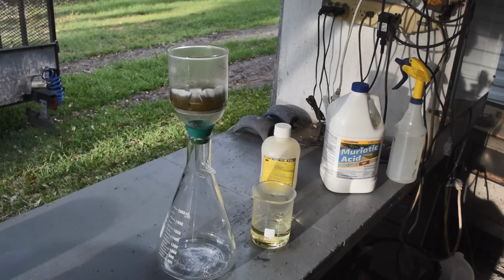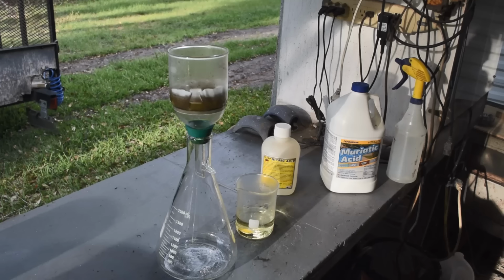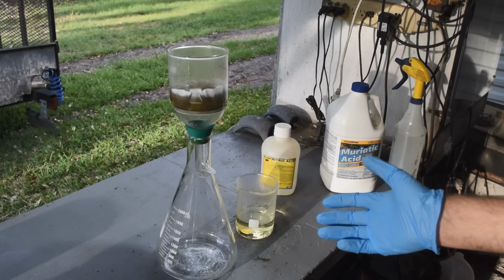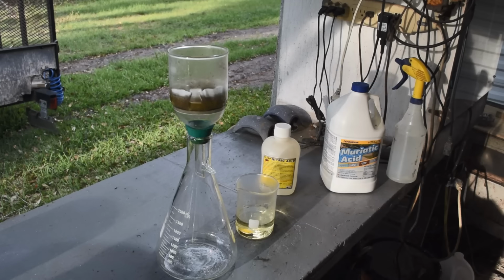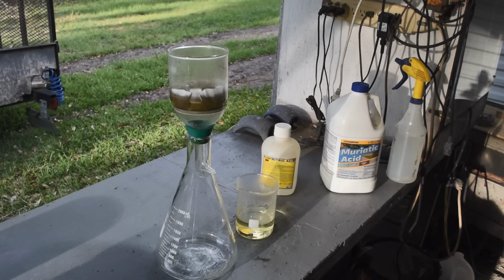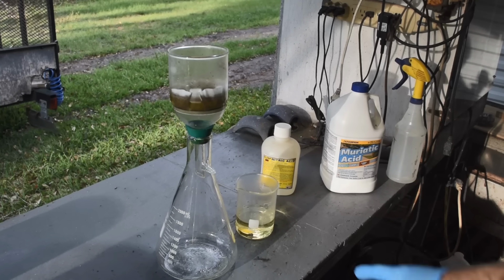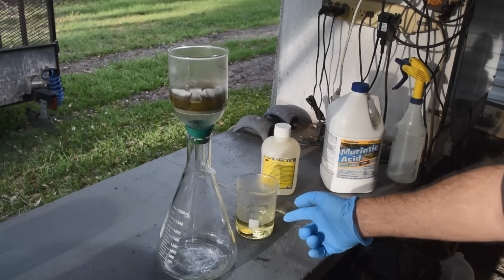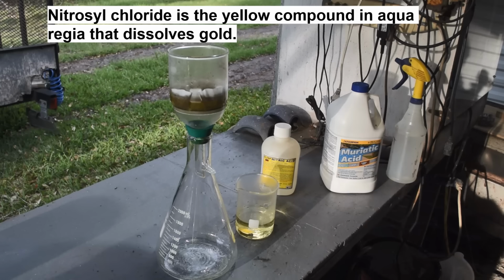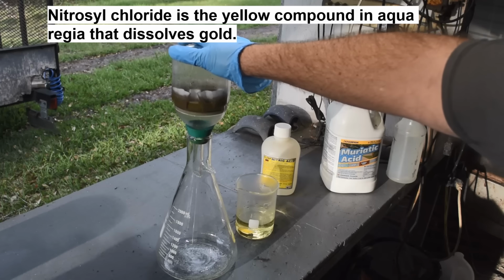Well, we'll just let it go, and I will dump the rest of this in after it's come through. And it's like I did with hydrochloric acid, I will run it through a second time. I'll just dump this back out into this beaker and run it through a second time and make sure we get all that gold dissolved in there. Oh yeah, it is turning yellow. Yeah, of course this is turning yellow too. When you mix hydrochloric and nitric, you get, I forget the name of the compound that's yellow, but that's the stuff that dissolves gold. But yeah, it's coming through. It's looking like the right color.